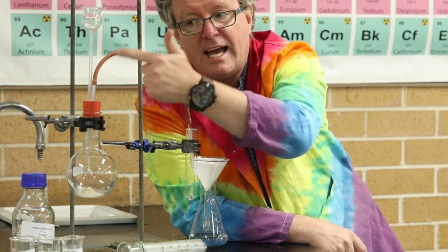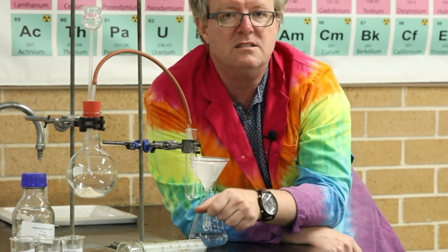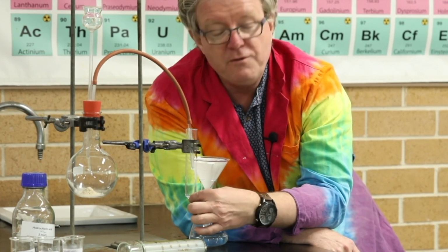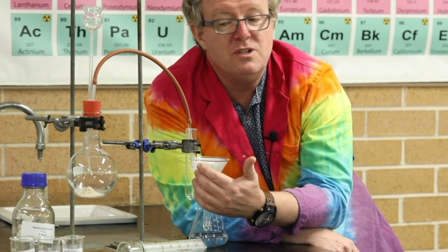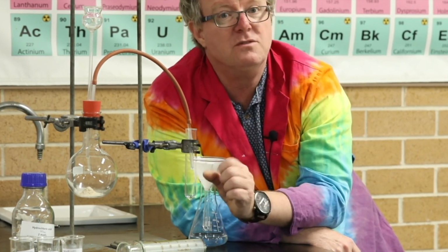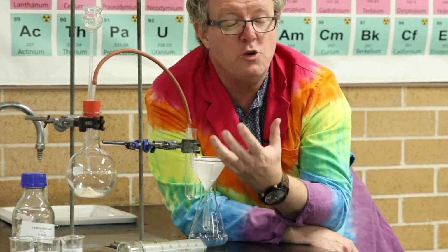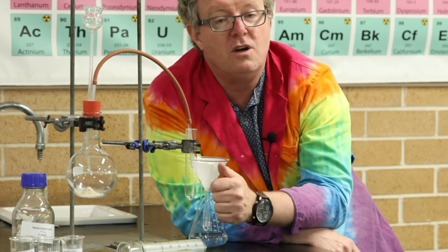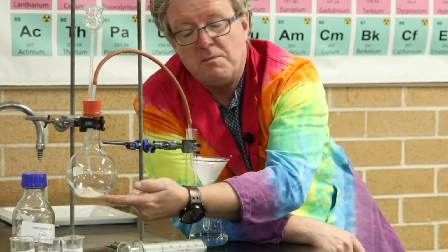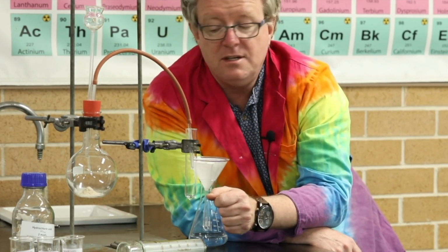Then we're going to collect the gas, and the gas is going to go down and be bubbled through some lime water. So the classic test for CO2 gas. And so if there's CO2 present, it's going to go milky white. But if we wanted to do this experiment and measure the amount of gas, and let's say you wanted to do an investigation where we're using your understanding of moles to work out the number of moles of gas produced from a certain amount of solid or a certain amount of acid added, right?